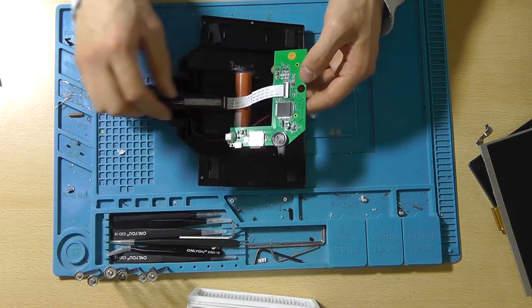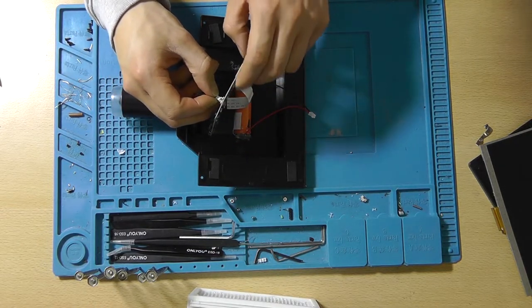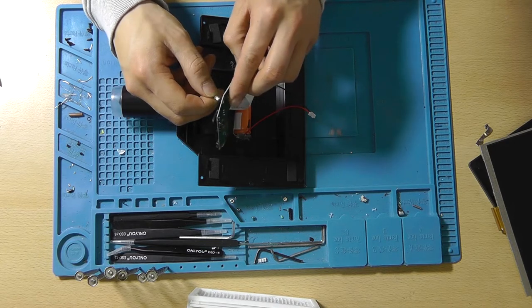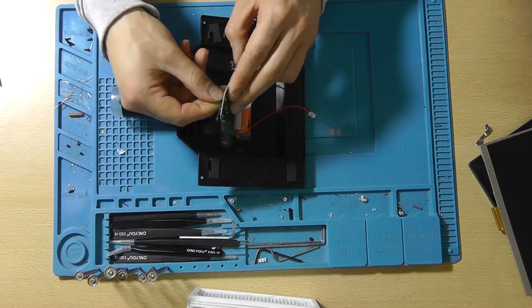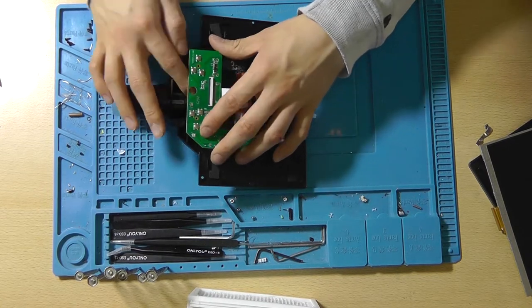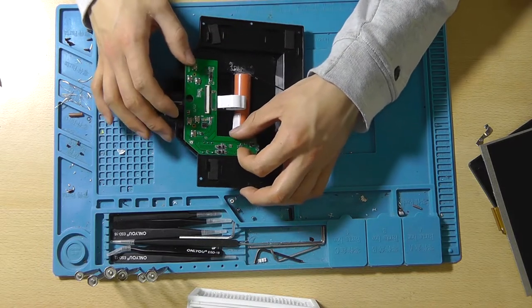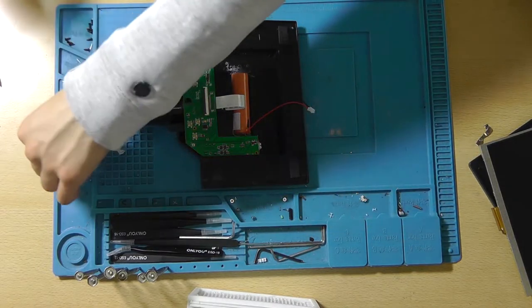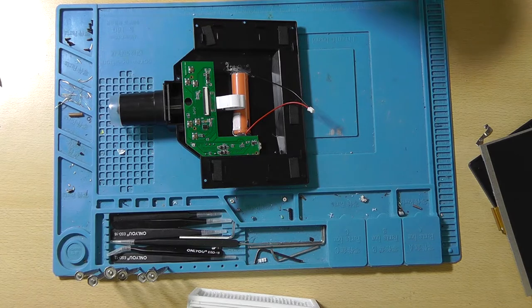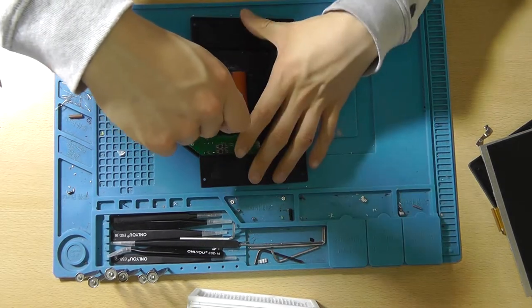Like so. Connect the flashlight. Let's connect the LEDs, like so. Now that's all in place. Let's put the board back in its position and screw it down like so.